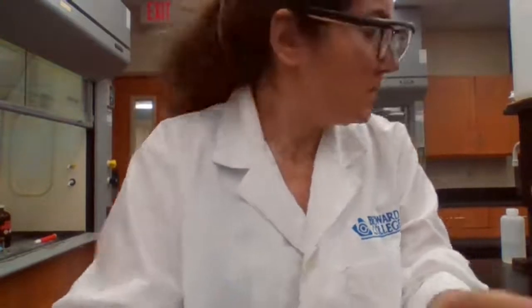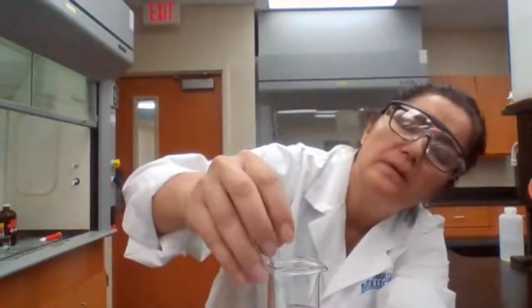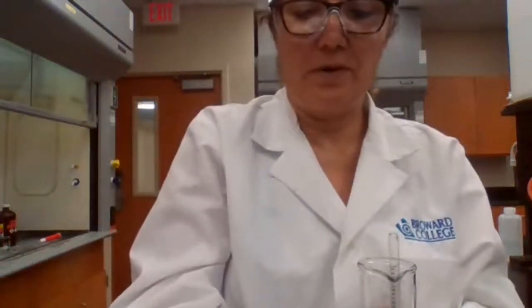Specific gravity for B. So I'm basically reading the hydrometer here. You have to let it float. Three, two, five. Okay, 1.34. I can read from here, 1.34. Zero. 1.340.